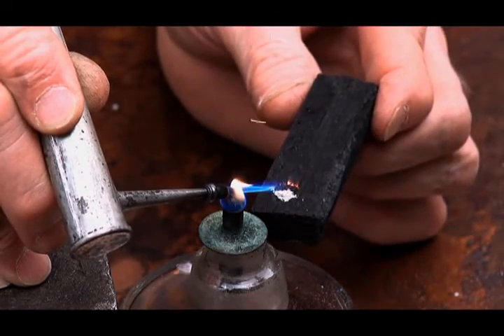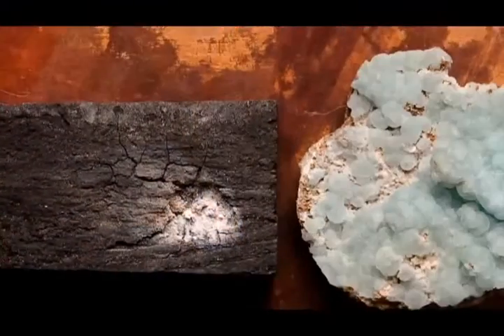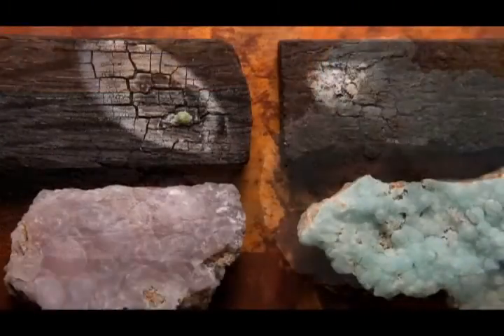When zinc silicate is powdered and subjected to the heat of the blowpipe, it reacts differently. The sample heats rapidly but fails to release its zinc. After the test is completed, the lack of a white powder on the charcoal shows that this ore, zinc silicate, is a poor choice for making brass and should be avoided.